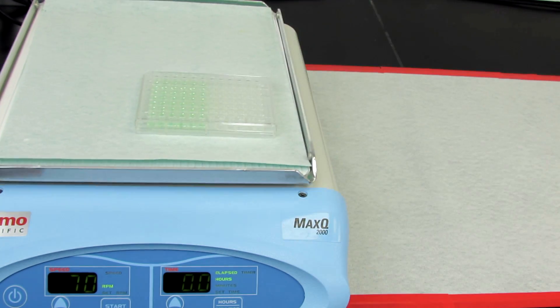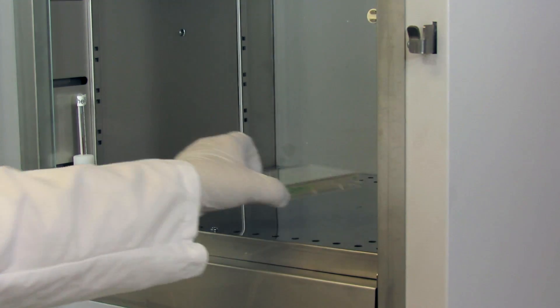Gently mix the components for 30 seconds, and then incubate the plate at 37 degrees for 30 minutes.